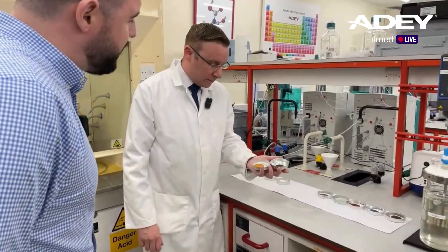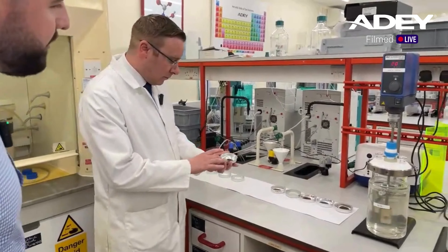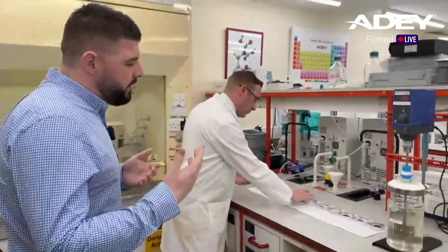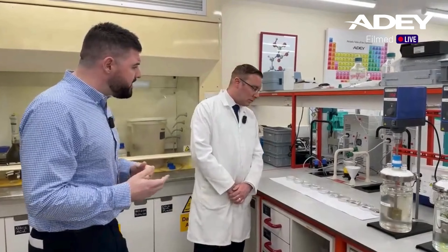Really, if there's anyone on a call that has a job where they're not quite sure what's going on with the water quality - there's a lot of rust, you're not quite sure the best way of treating it - sending a sample here will give you that full analysis and you guys can give a recommendation of exactly what you think we should do to resolve the issue. Yeah, definitely. Fantastic. And what's this one here, Josh?